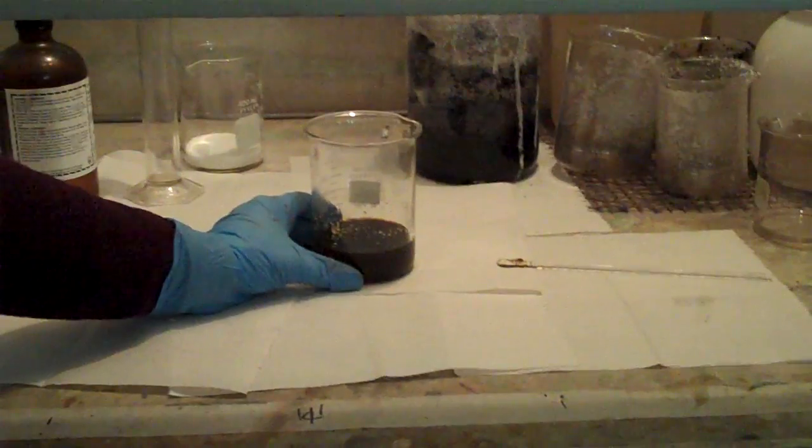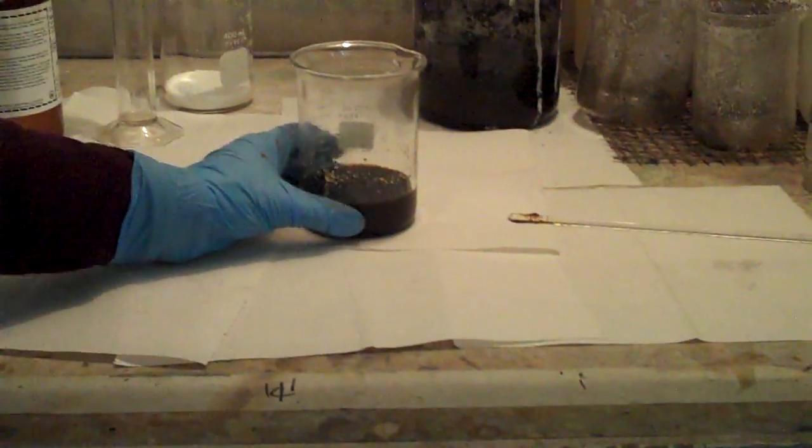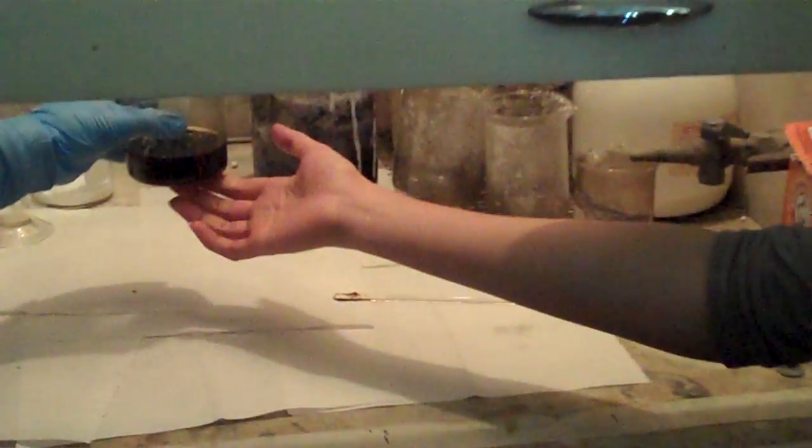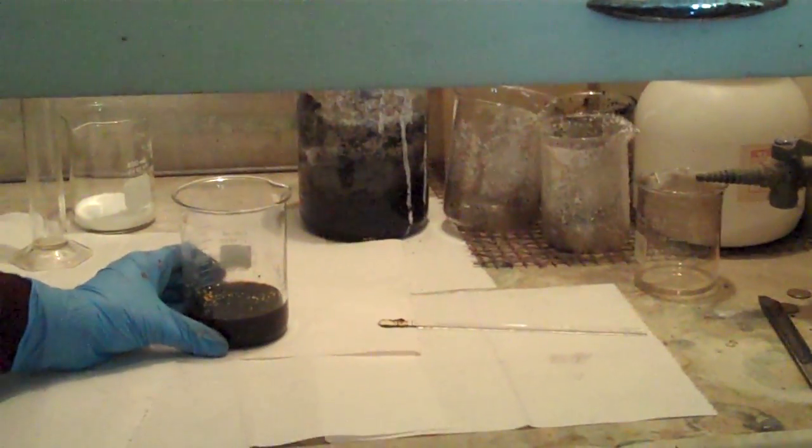This is an extremely... Actually, Charmaine, do you want to touch the side of the beaker? Tell me what you feel. Just the bottom of it? Touch the bottom. It's hot. It's hot. It's getting warmer.